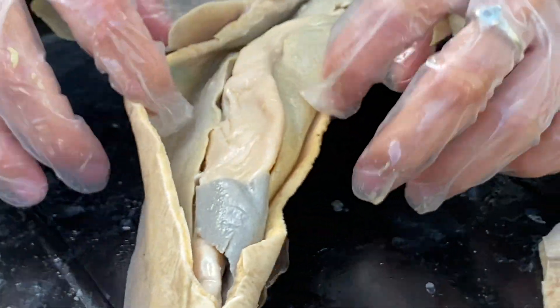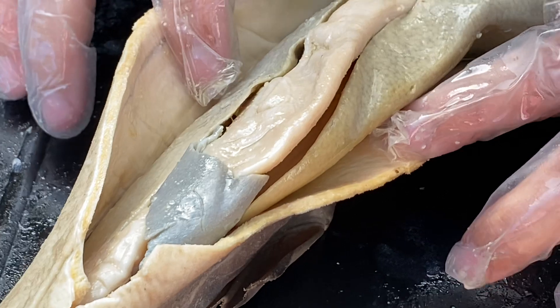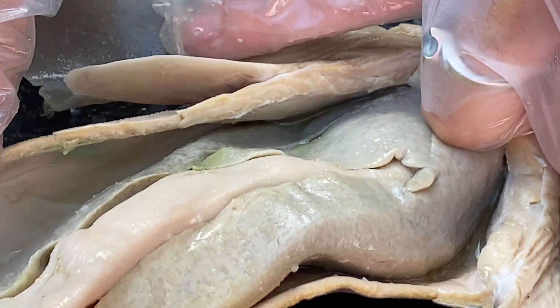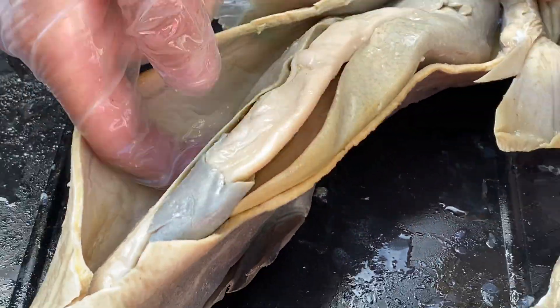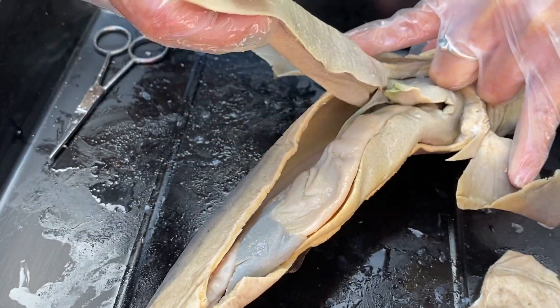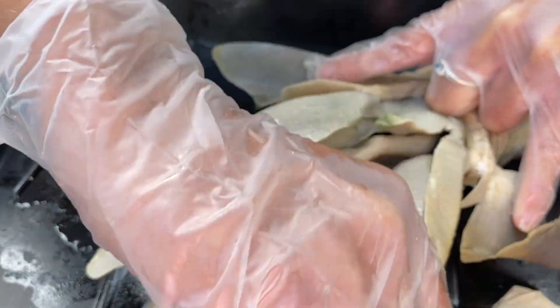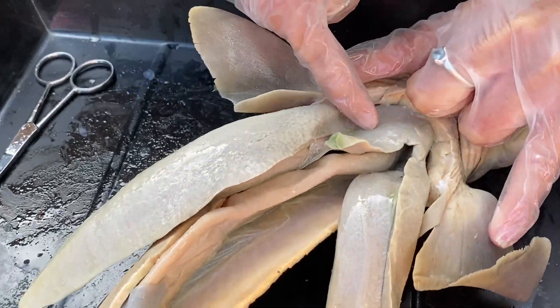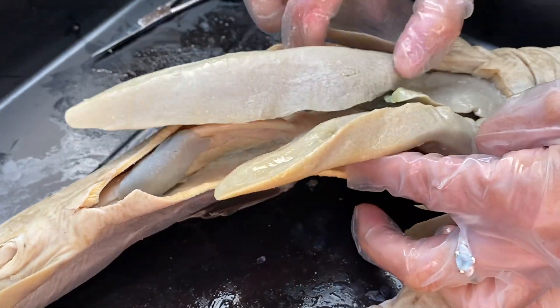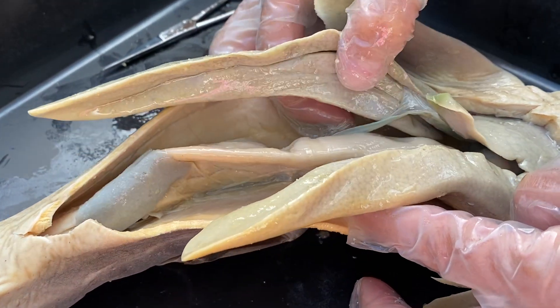So let's go ahead and look at what we see right here. The largest organ in the whole entire shark's body is its liver, and its liver is not a one-lobe liver like ours or two — it is actually three. Here is one lobe, it looks like a life jacket; here is two lobes of the liver, and here is a third medial lobe. Look how huge that liver is and how much space it actually takes up inside the body of the shark.